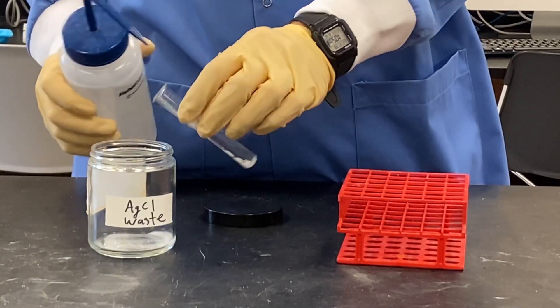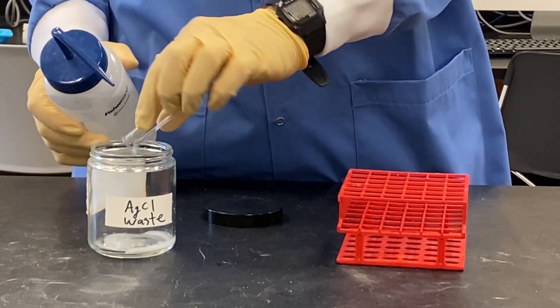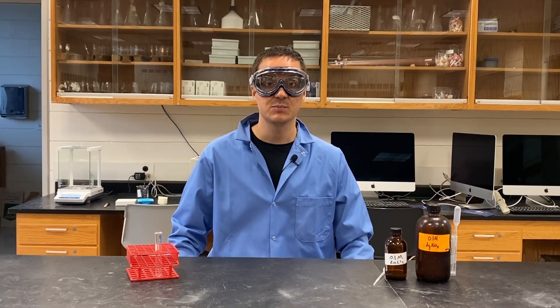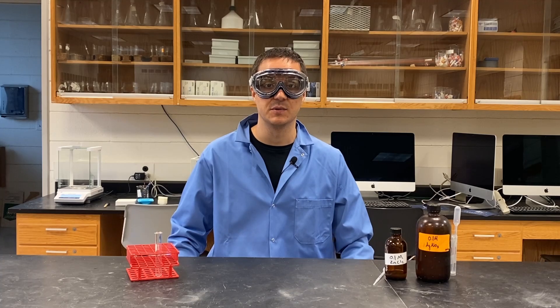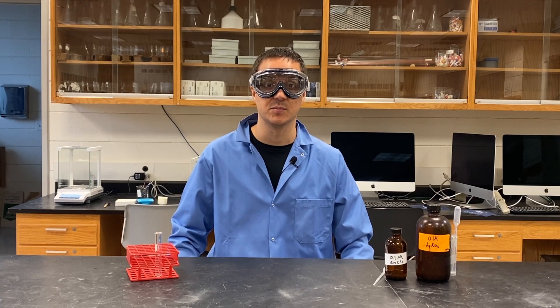The contents of the tube are rinsed into the provided waste container. This process is repeated with all the pairs of chemicals listed in the procedure.